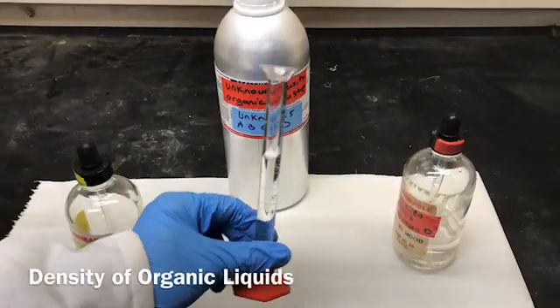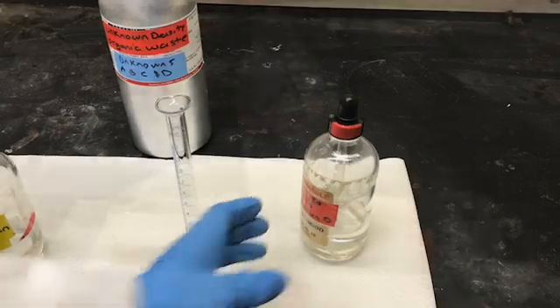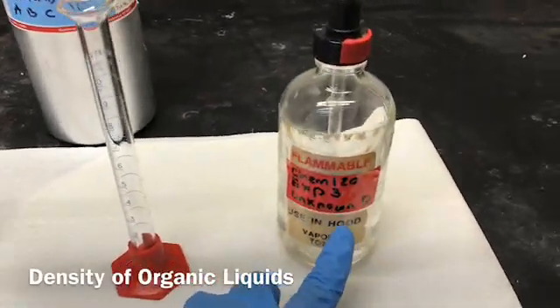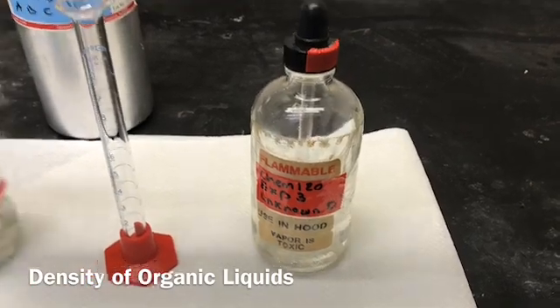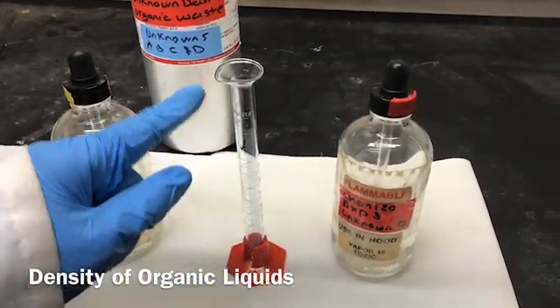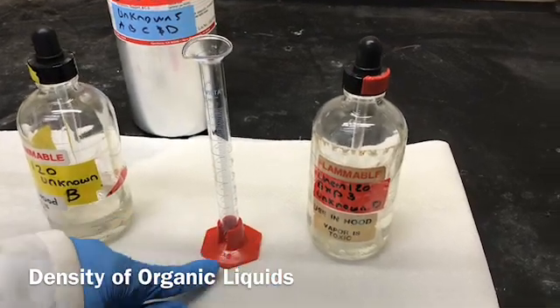Now I'm going to dispose of unknown liquid B into the waste container. Okay, now it's time to record the measurements for unknown liquid D. Well, we already had unknown liquid B, right? So this measuring cylinder does have a very slight amount of unknown liquid B, which might affect the density of D.